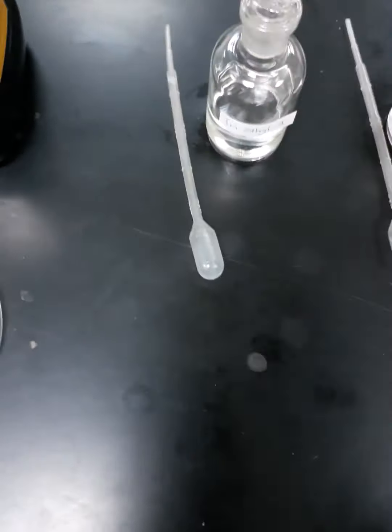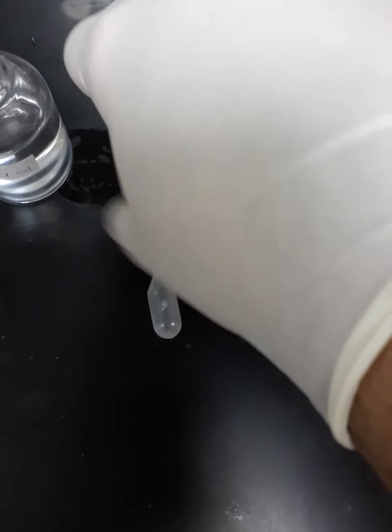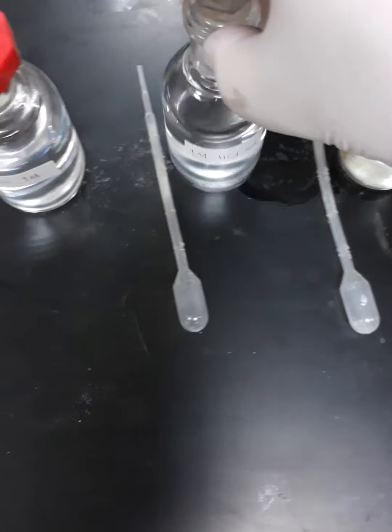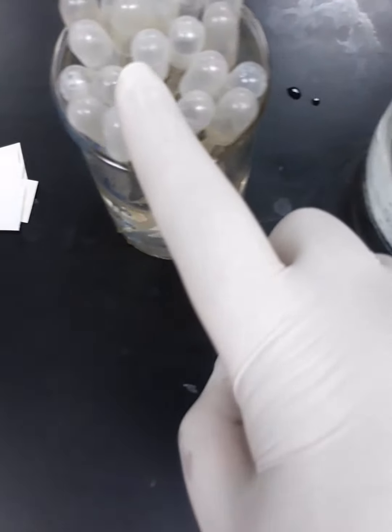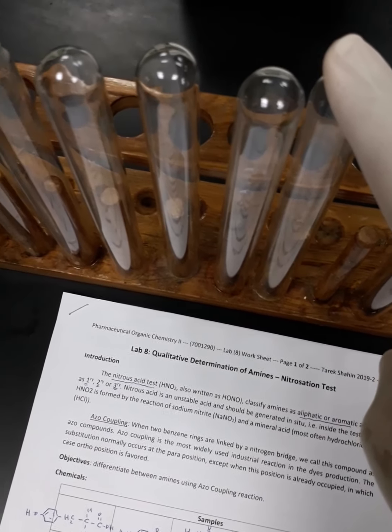Now let's move to the reagents. This reagent is alpha naphthol, and this one is beta naphthol. Then we have sodium nitrite reagent. Then we have 1 molar hydrochloric acid solution, 1 molar sodium hydroxide solution, distilled water and distilled water dispenser, and an ice bath, in addition to plastic droppers, labels for the test tube rack, and test tubes with capacity between 10 to 25 milliliters.